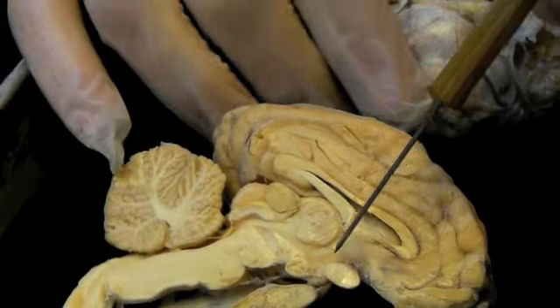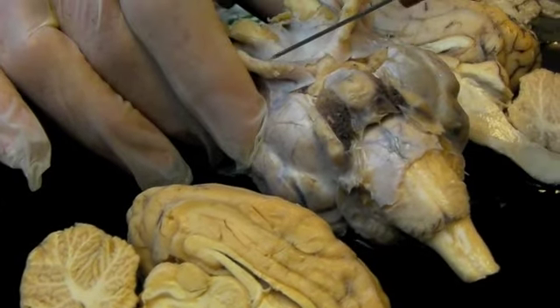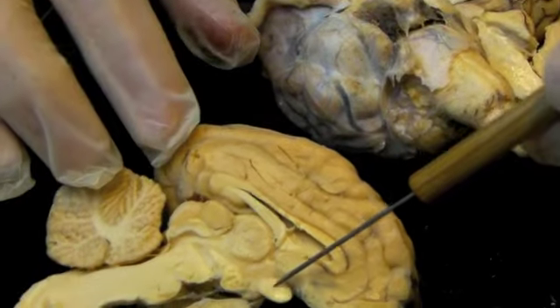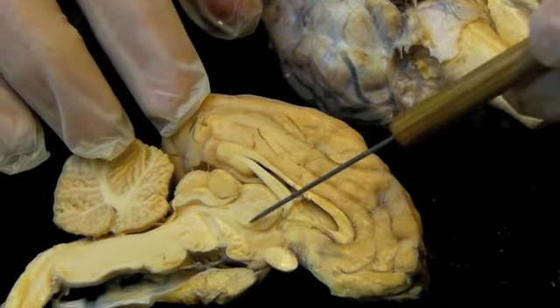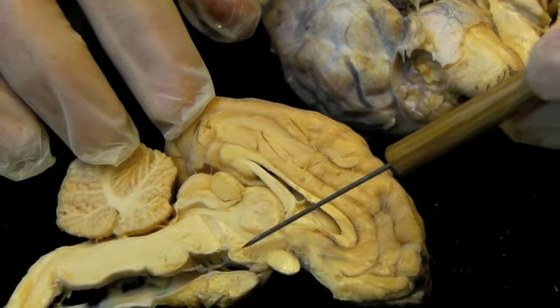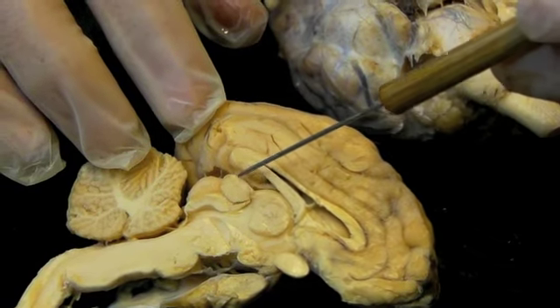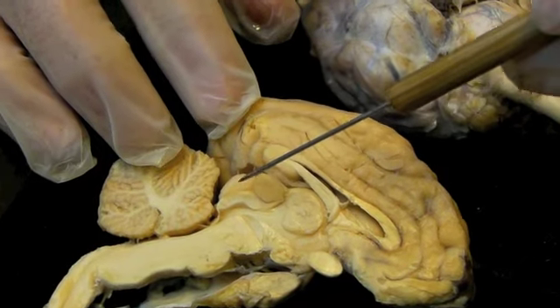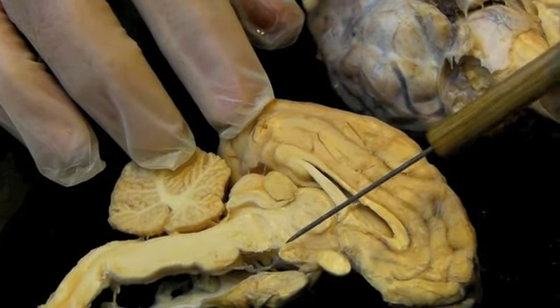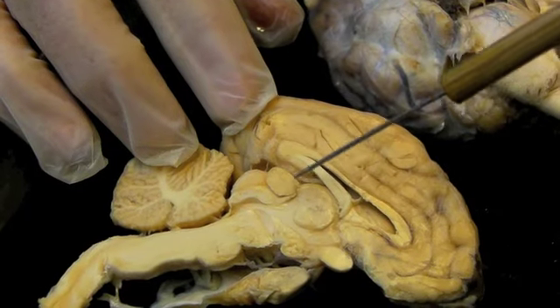You have to think a little three-dimensionally with the brain. Looking back at this model here, remember the optic chiasm is where the optic nerves cross, so we cut right through there. So now we're seeing it as this. The thalamus is a rounded area here. This area in here is the hypothalamus, which the mammillary body is part of. Behind that, posterior, is the pineal gland, and then we're back to the colliculi. So midbrain, cerebral peduncle, mammillary body, pituitary, optic chiasm, thalamus, pineal.